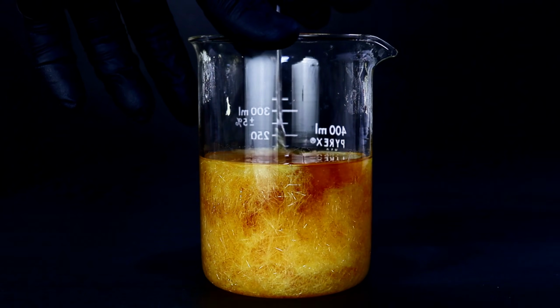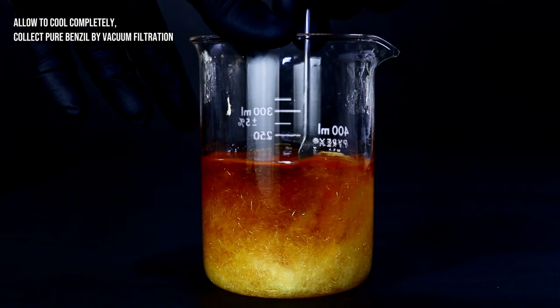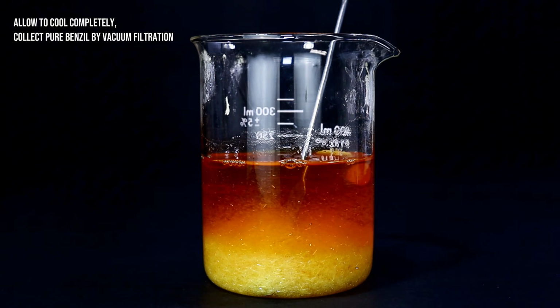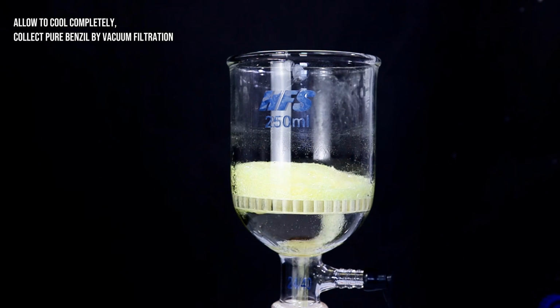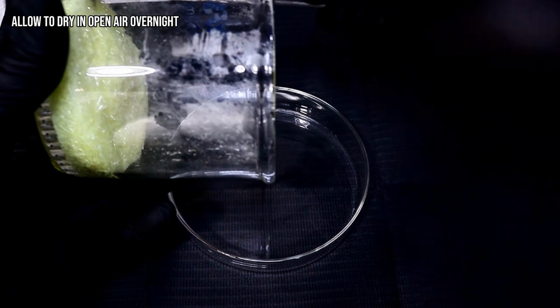After allowing the Benzil to cool to room temperature, I put it in a freezer until it had cooled to around negative 15 degrees Celsius. I then simply broke up the pure crystals, collected them in my Buchner funnel, and then rinsed them thoroughly with cold ethanol. These were then finally transferred to a petri dish and allowed to dry completely.